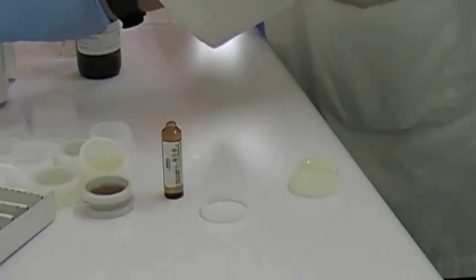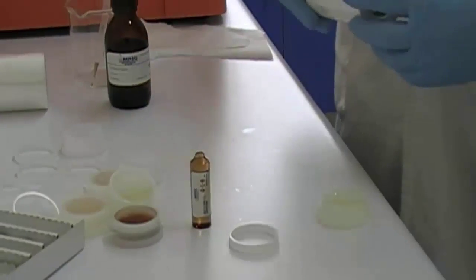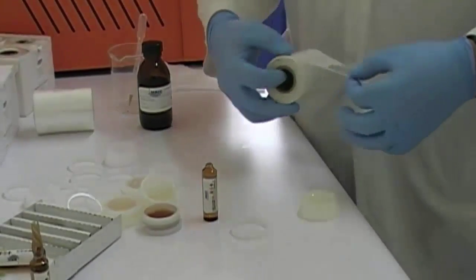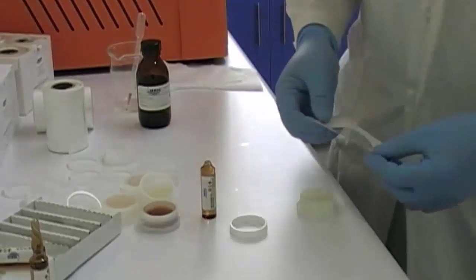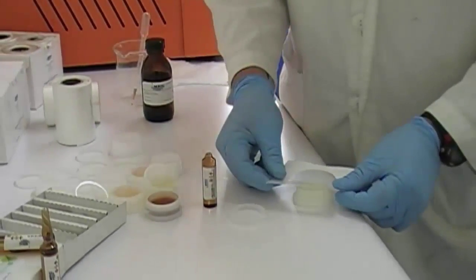Third, take the film roll and cut in the necessary part. Fourth, cover the cell at the top.